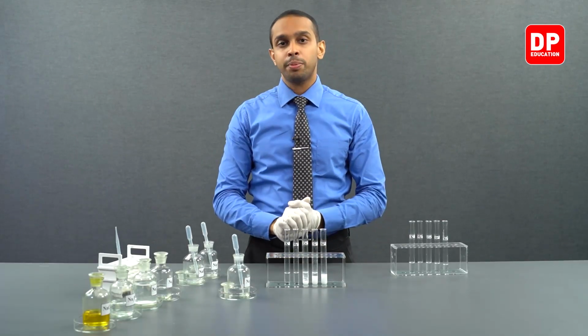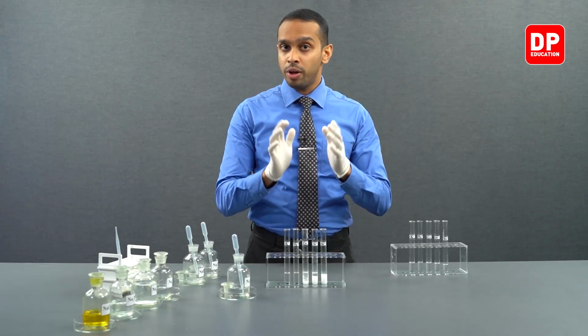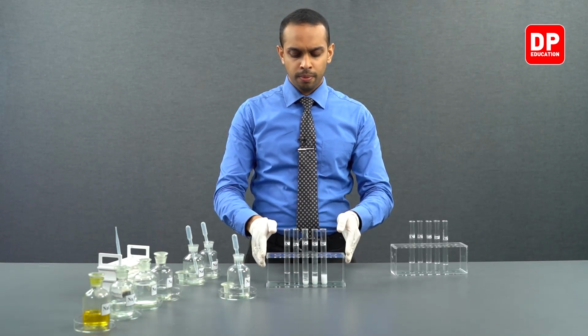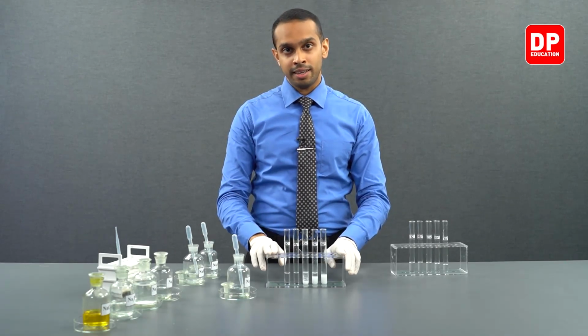These are all white color precipitates, and this is what happens when we react sulfate ions with S block cations. Now, let's move on to sulfite ions.